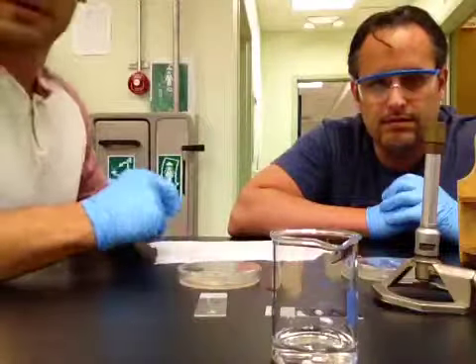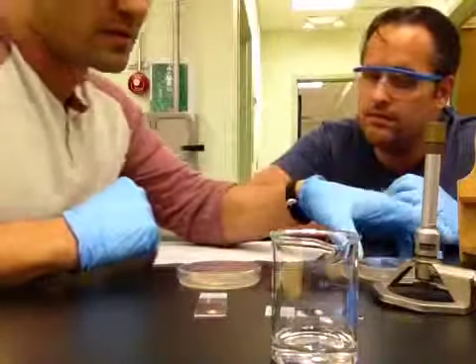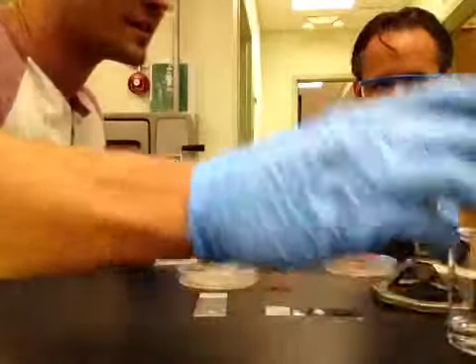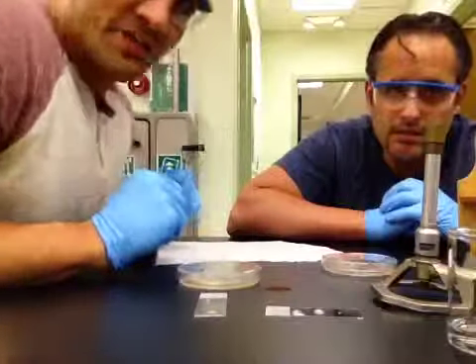Okay. So the first thing we're going to do is take some E. coli, which we have been given by Ms. Sedaris to use today. And throughout this test, we will be using aseptic techniques.